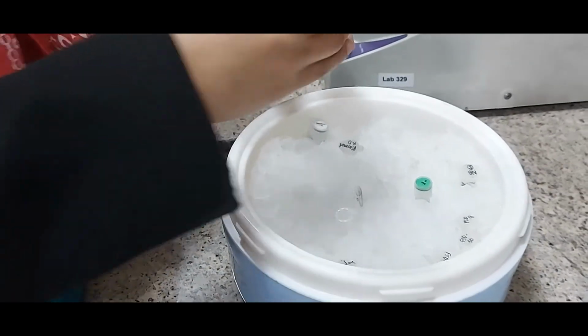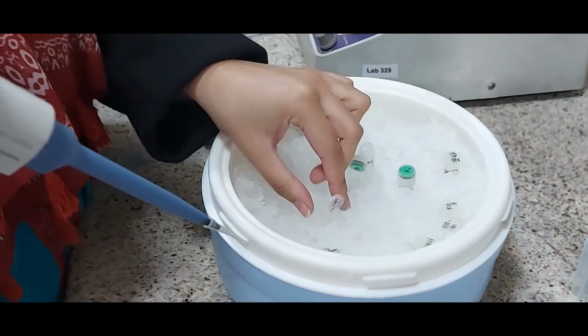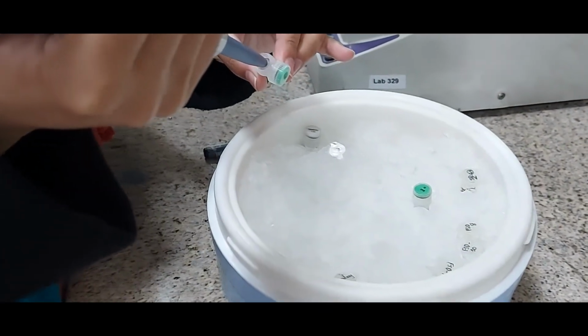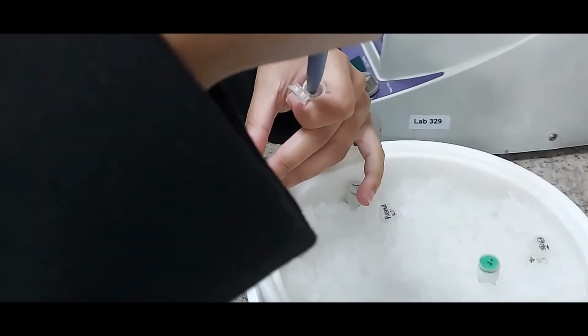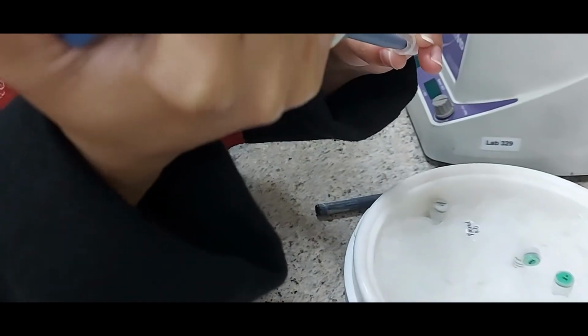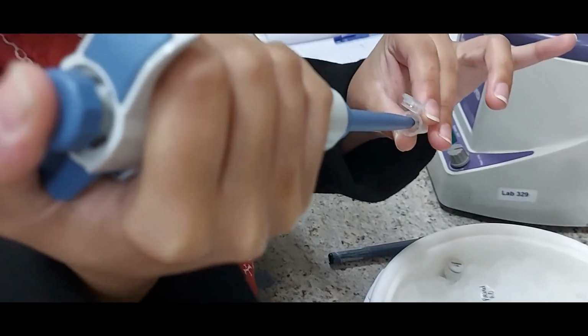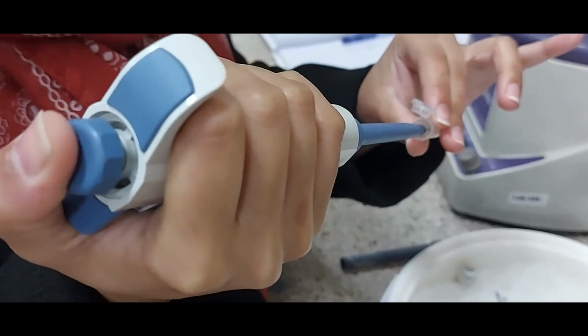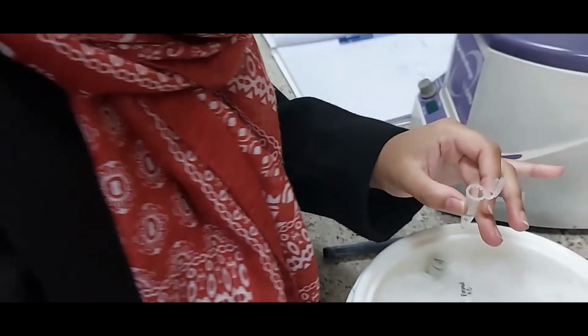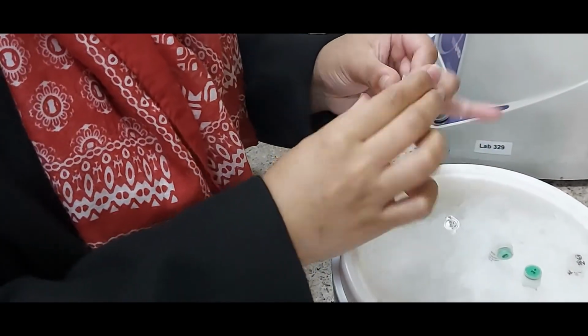The only thing is you have to have the genomic DNA or the plasmid DNA pre-isolated, and then only the 4 ingredients are added to the restriction digestion mix. Now she has taken the restriction enzyme and is adding it to the tube so that all the 4 ingredients are now complete there. She's just mixing that, okay? And after mixing it, she can place this tube at 37 degrees centigrade.